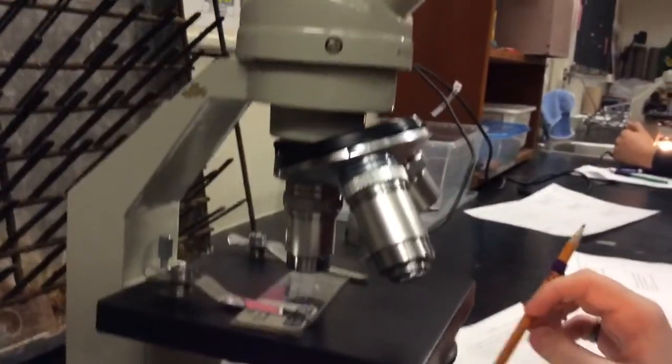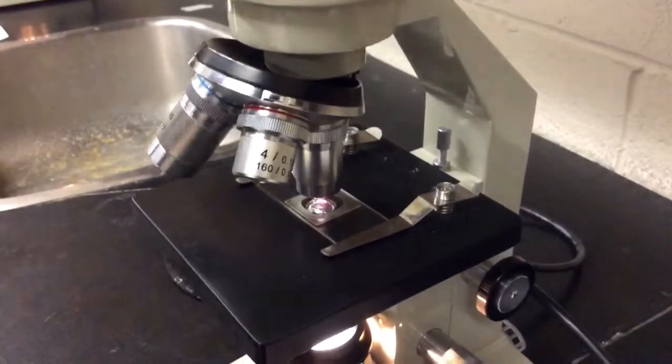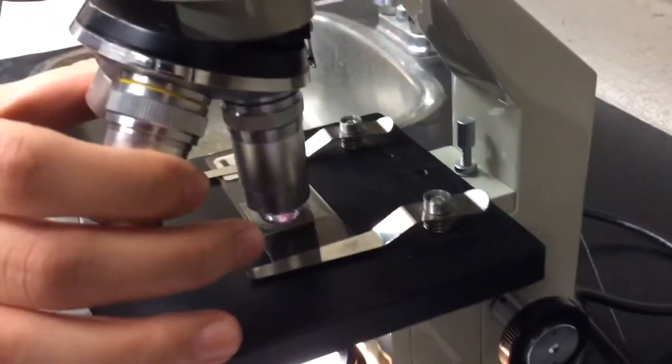Tell me, how are you gonna calculate the magnification? That's what I was trying to ask you. This is how you switch a lens from medium power to high power. Bam.